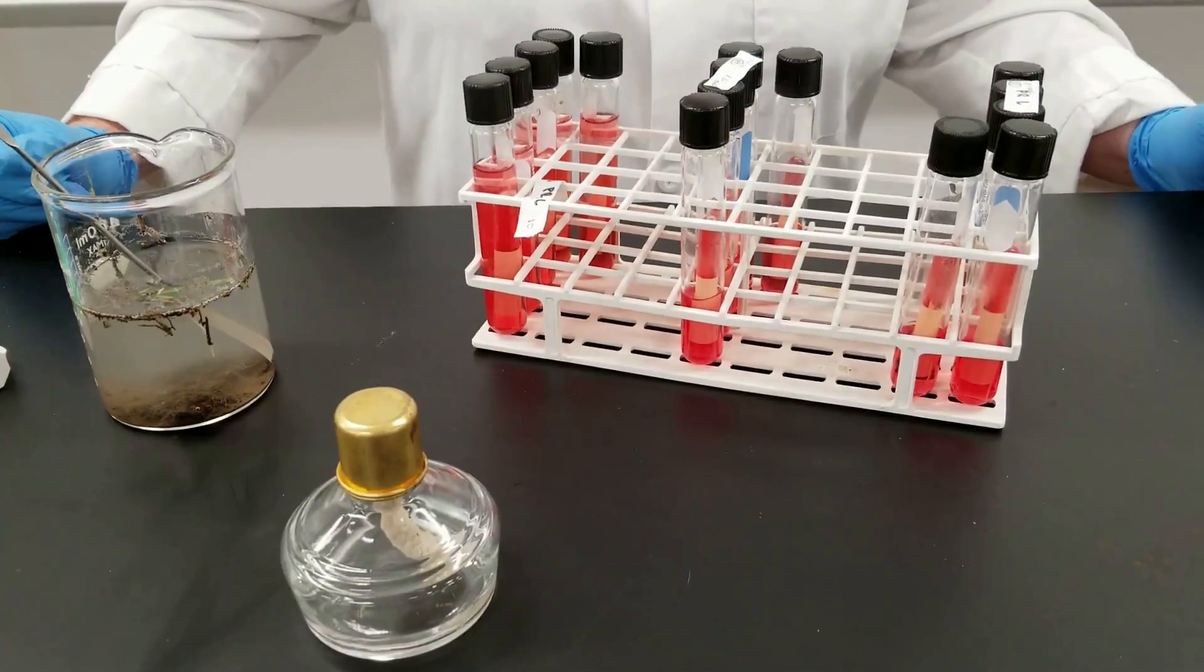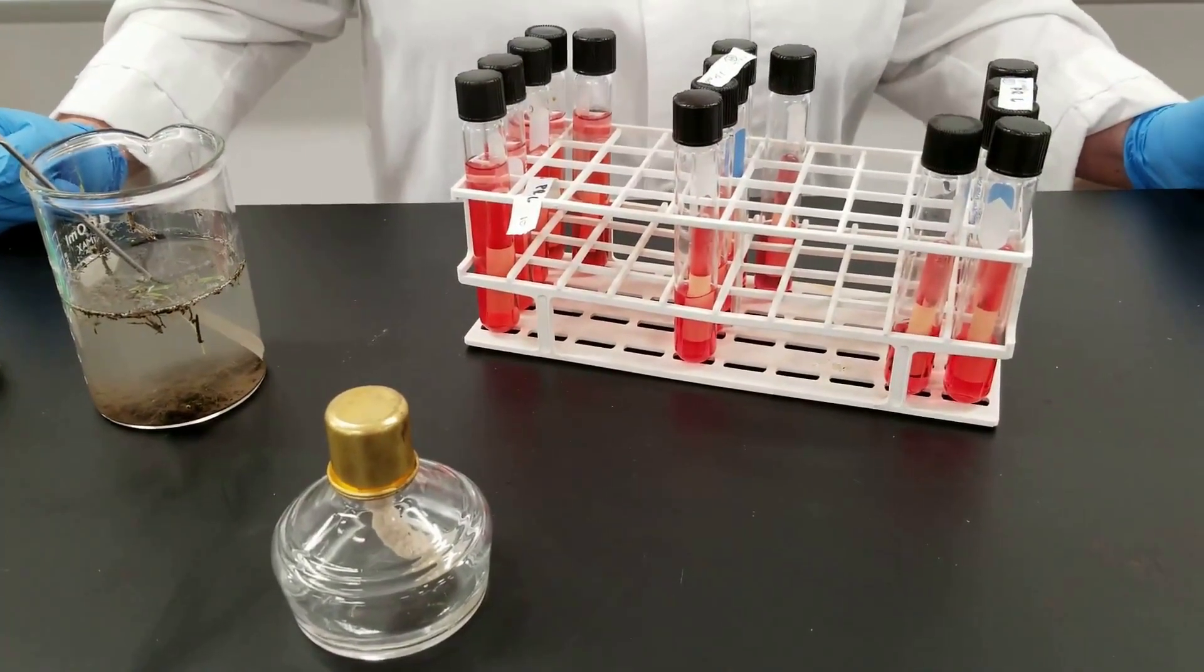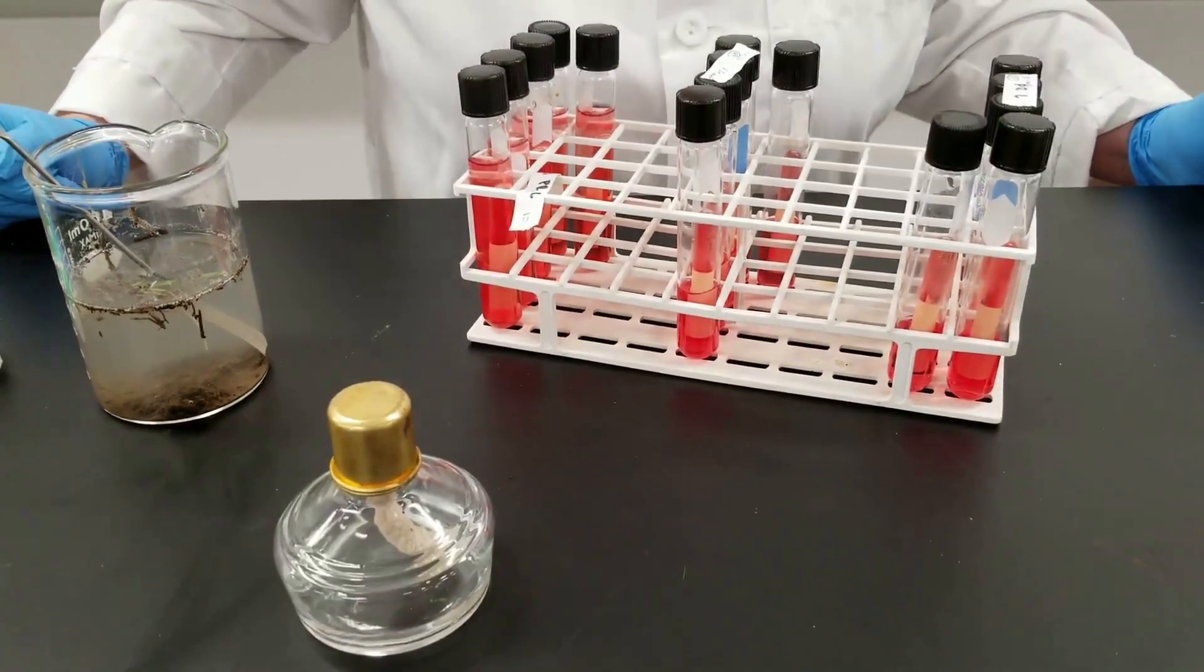There's an experiment that we do with water, looking at the microbiology of water, trying to test to see essentially what's in the water.